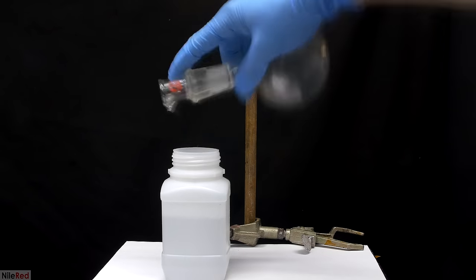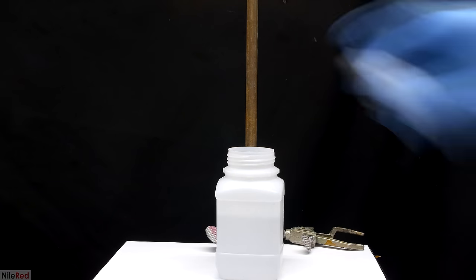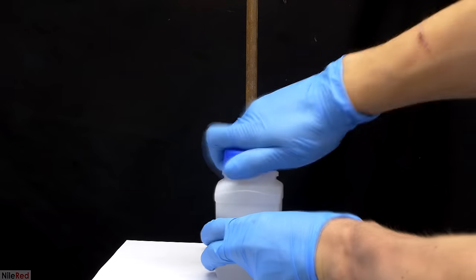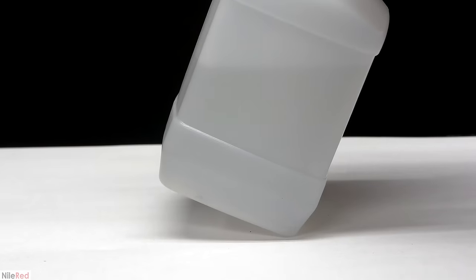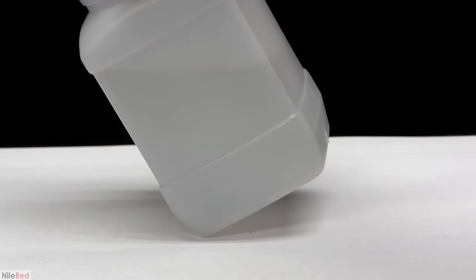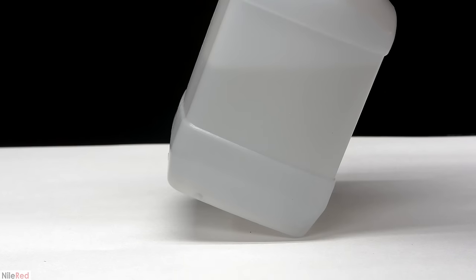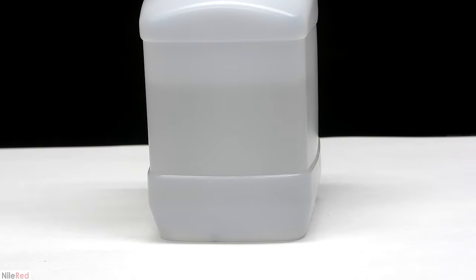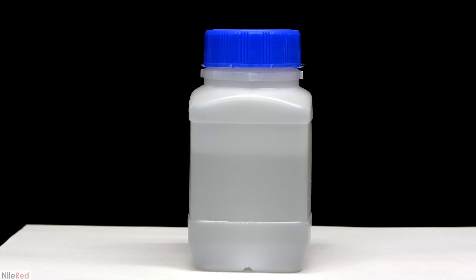Something interesting is that if you look at the bottom of our storage container, you can see there's a little bit of mercury there. This means that during distillation, some of the mercuric chloride broke down back into metallic mercury and was distilled over into our receiving flask. When mercury is used as a catalyst in this preparation, this is a pretty common occurrence. If I wanted to, I could have removed the mercury using something like a pipette, but it's not really a problem here, so I just left it.